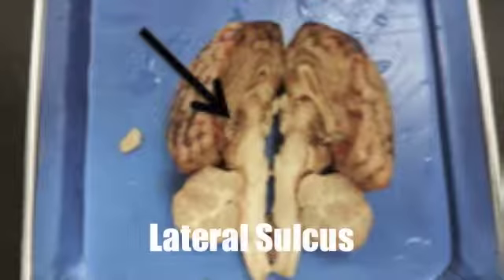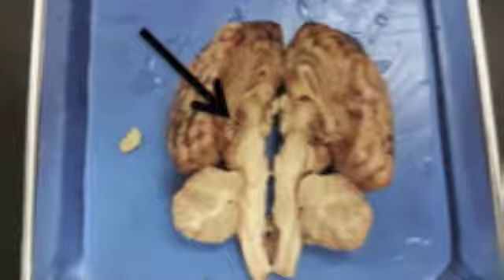The lateral sulcus is one of the most prominent structures in the mammalian brain. It divides both the frontal lobe and the parietal lobe, which are above, from the temporal lobe, which is below.